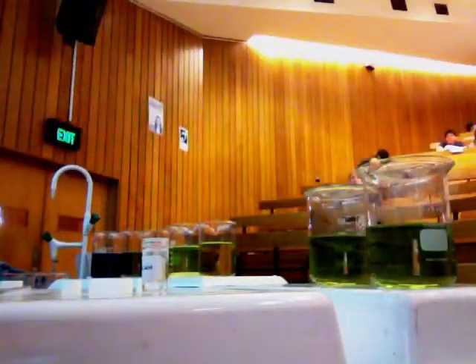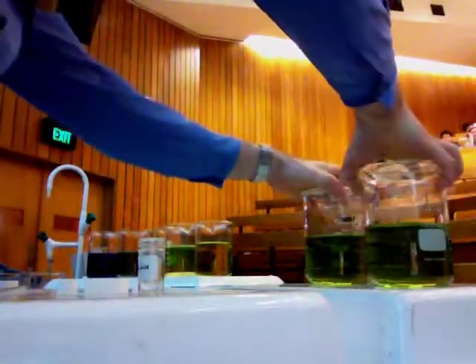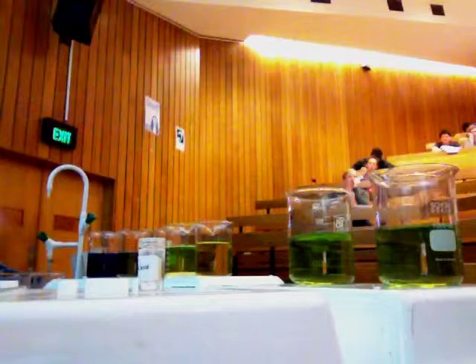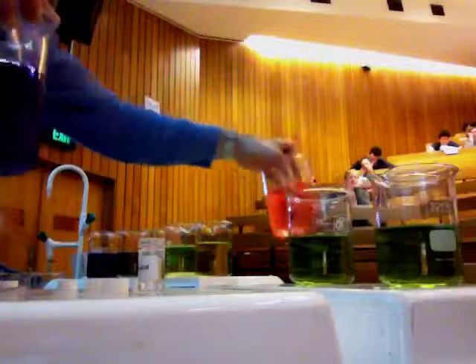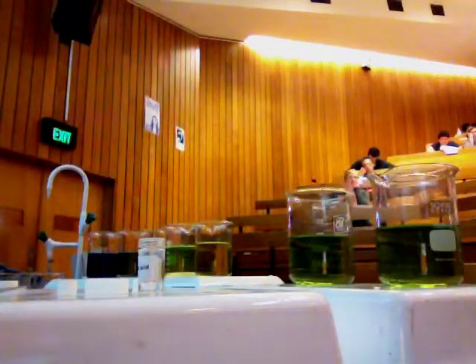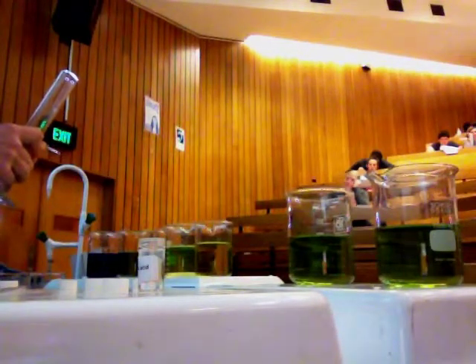So I've got a buffer solution in here now. I've got my buffer solution instead of the pure water. Remember what happened to the pure water when I added the acid and the base — it changed by loads. Now I'm going to add in the same amount of HCl to a buffered solution, so it contains an equal amount of a weak acid and its conjugate base. And we shouldn't see anything.